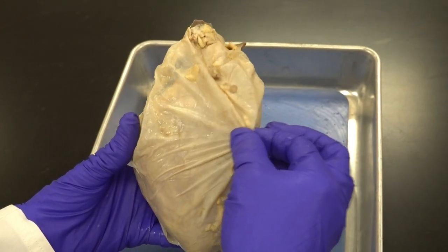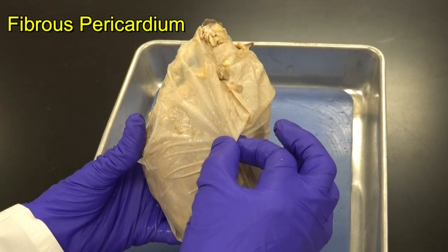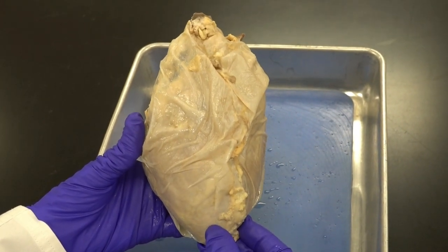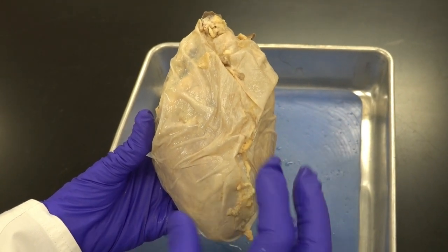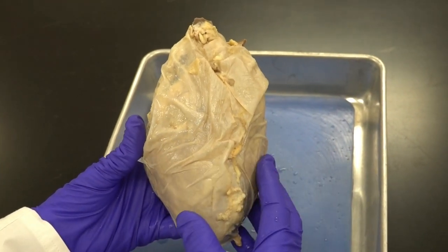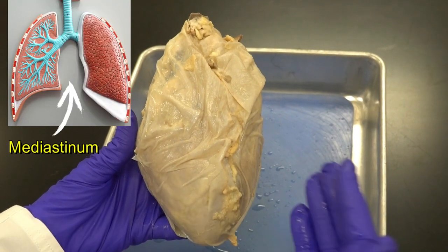The first thing I notice is this strong sac that is around the heart — that's the fibrous pericardium. This is a dense irregular connective tissue that rests on and is attached to the diaphragm. It protects the heart and does not allow the heart to overstretch, anchoring the heart in the mediastinum region — the space in the thoracic cavity between the two pleural cavities.